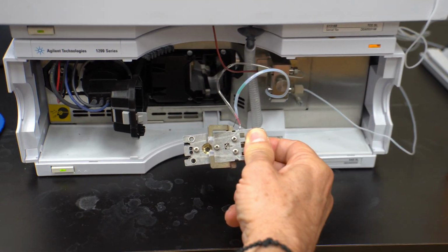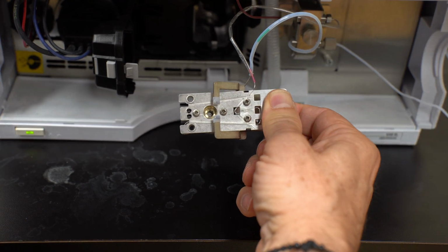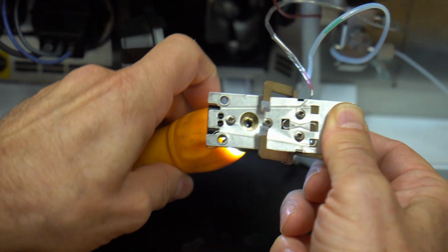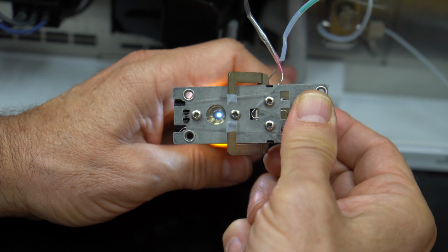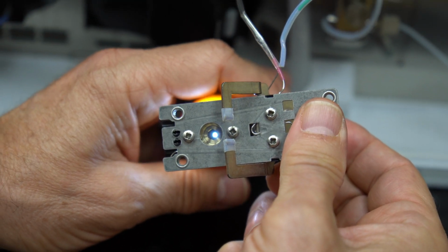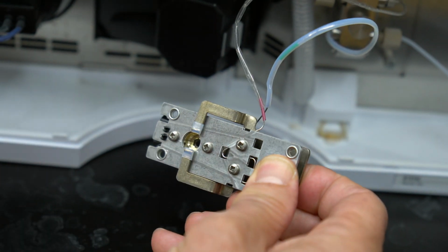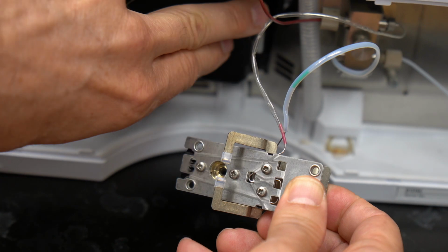Now the flow cell, there's liquid going through it right now. What I find interesting is it's a really simple design. It's a block of stainless steel with a quartz window on each side, and then we just shine light in to see if the sample absorbs light. So I'm going to put a flashlight behind this just so you could see right through that. So that's a quartz window. Again, we use quartz because it's UV transparent. And the way this detector works is it shines light in one side, and since there's a sample in the middle, it's going to measure to see if that sample is absorbing that light. So it measures the amount of light.